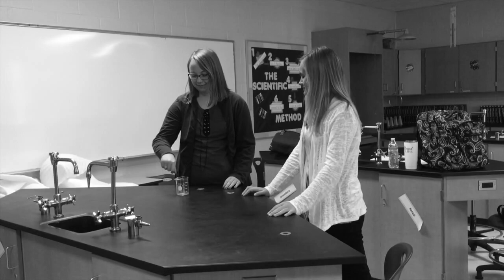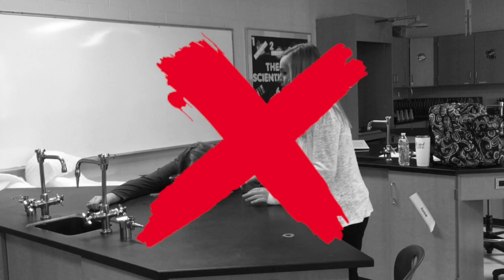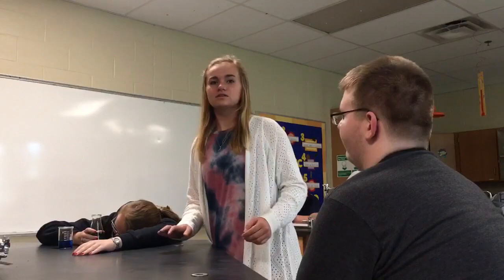Do you forget what to yell in case of emergency? Are your lab partners dying from laboratory injuries and lack of immediate attention? Try yelling, "Code 1, Code 1," to attract your instructor's attention and keep your lab partners from dying.